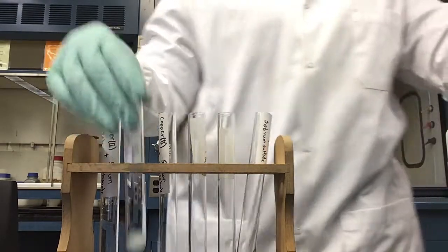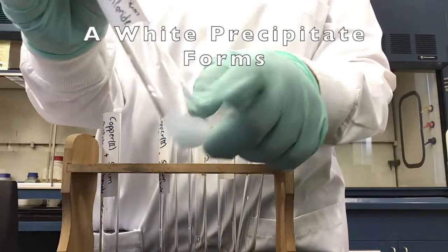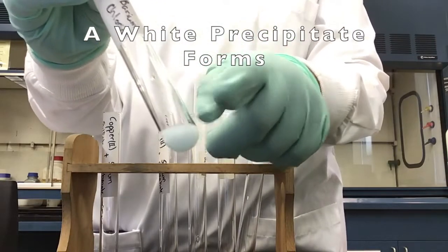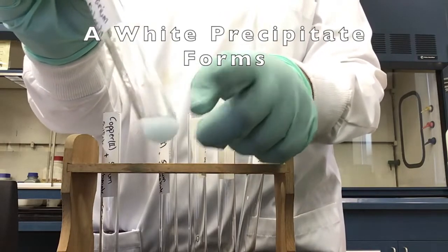After adding our copper 2 sulfate and our barium chloride together, we lightly tap the tube to mix. We see a white precipitate form in our test tube.